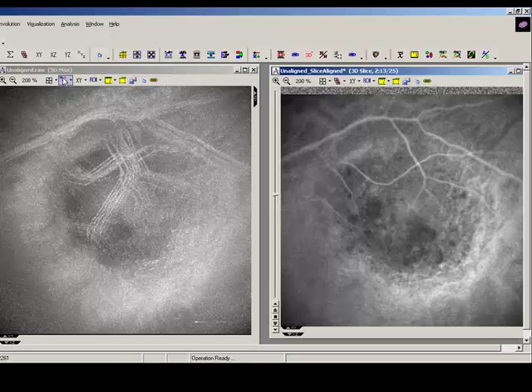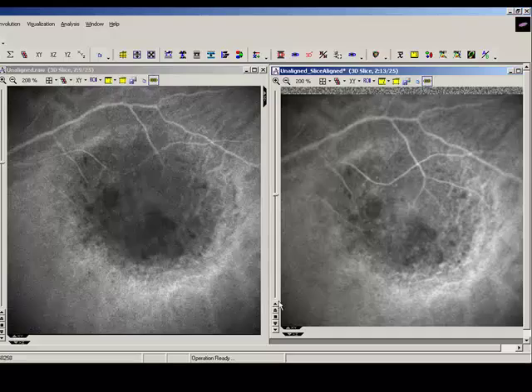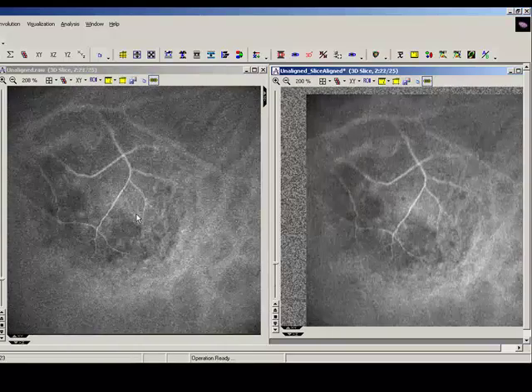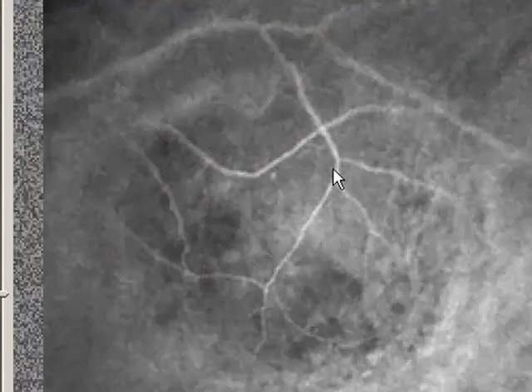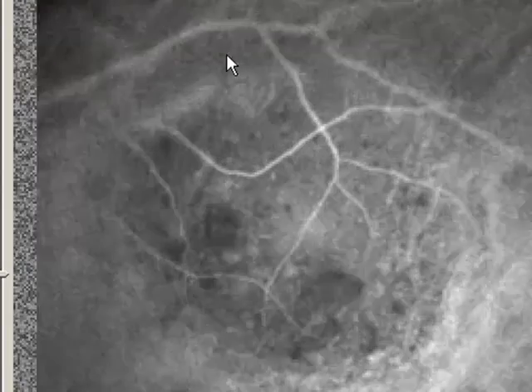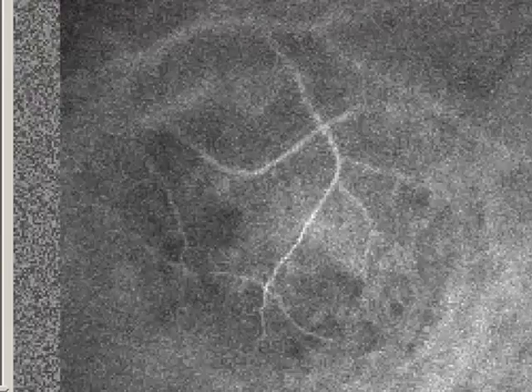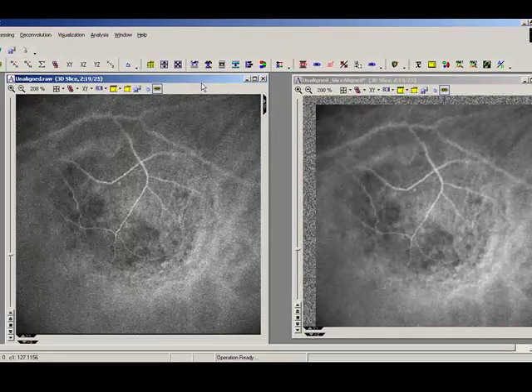Okay, now if I compare slices and synchronize both these sets, we should be able to play through and just see how good the alignment's been. Okay, so looking here on the left, we can see how much it's jumping around, and if we look at the aligned image now, it's really a lot better. It's a lot more static. We can look at these lines here and we can see they're pretty well aligned. They're still wobbling a little bit. Okay, so the alignment could be better, but that's a pretty good improvement, really. Okay, but let's see if we can just make the alignment that little bit better.